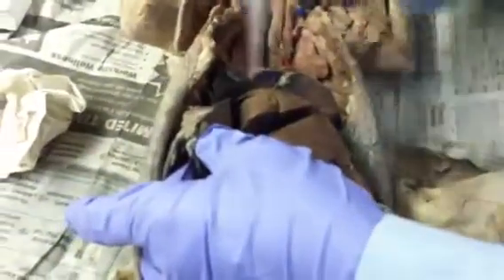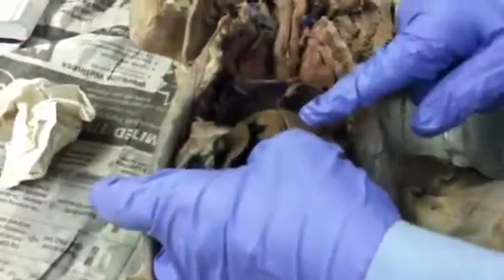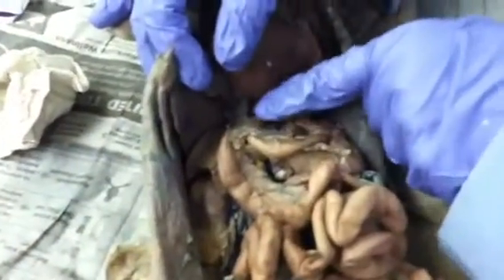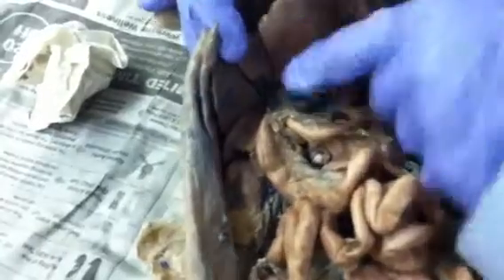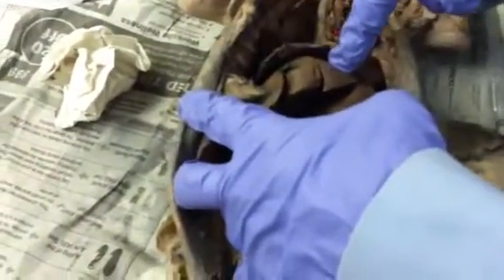Liver wise, right under the diaphragm, you have the right medial lobe with the gallbladder. That's the gallbladder. And the left medial lobe. That's our liver, right and left. Then under here, you would also have a caudate lobe, and a quadrate lobe. They have a caudate lobe. They don't have a quadrate lobe. So right and left medial lobes.